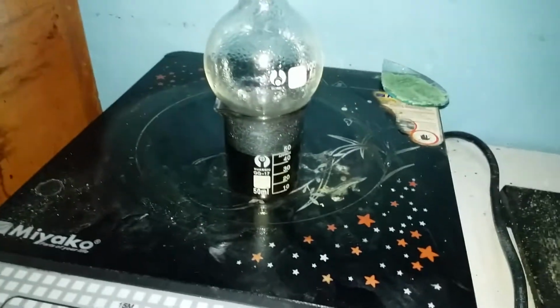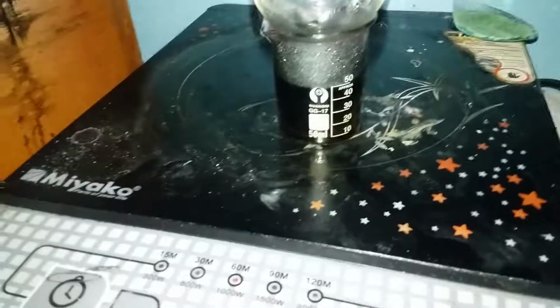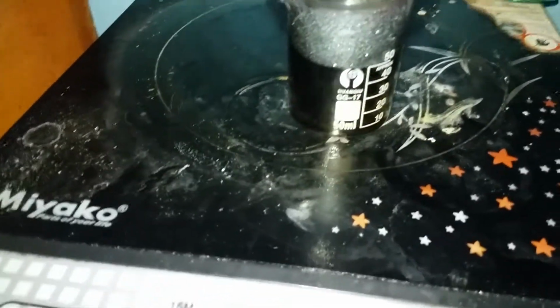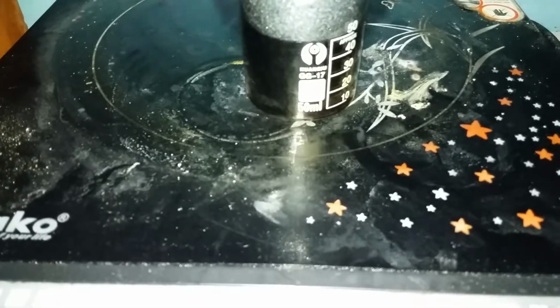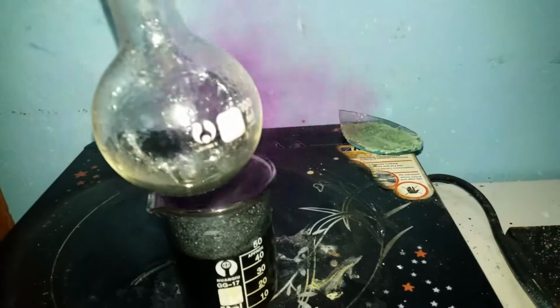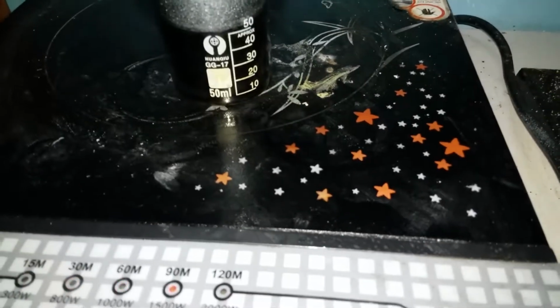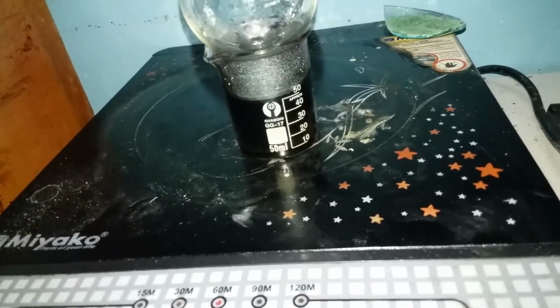Stopping this, wait, what? Okay, I'm stopping this thing because it's leaking really bad. I think I have a crack on my beaker, and I really can see some molten iodine. Wait. Oh shoot. That's always cool. Purple vapors. Okay, my eyes are burning because of its vapors, and I'm sleepy.